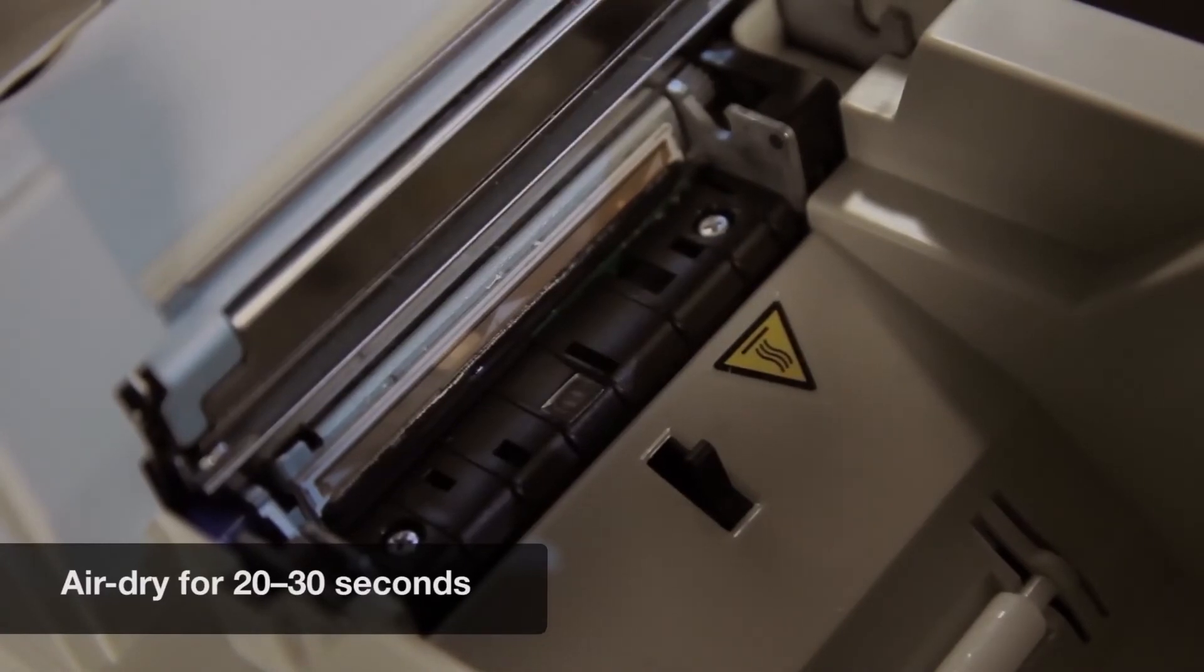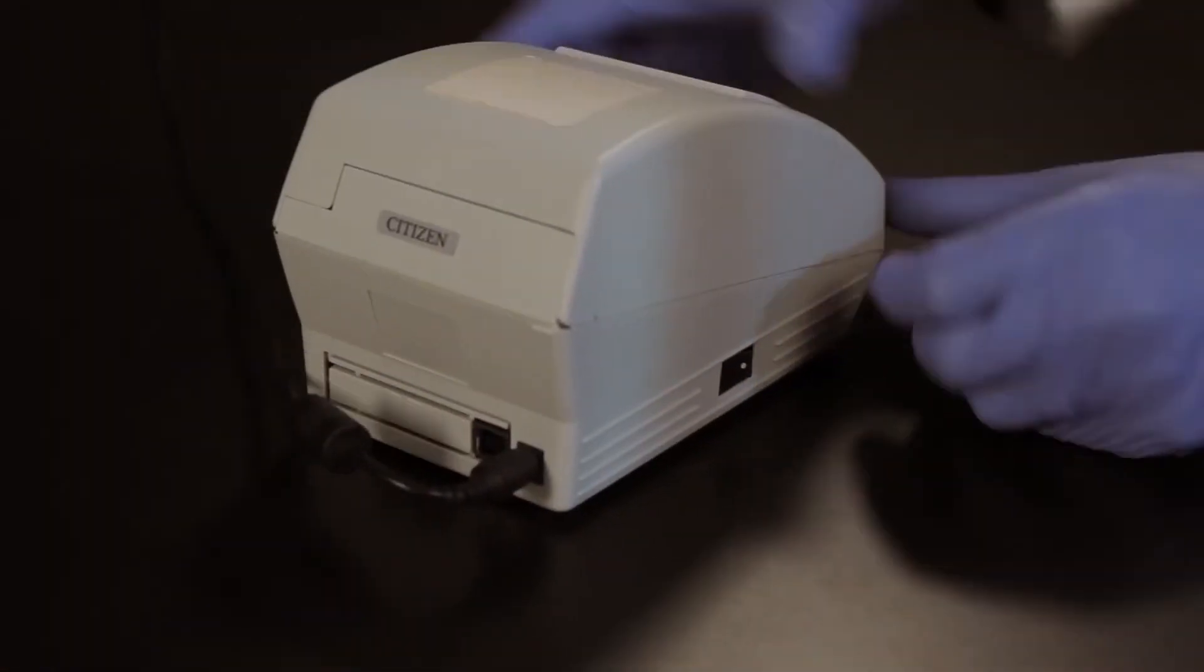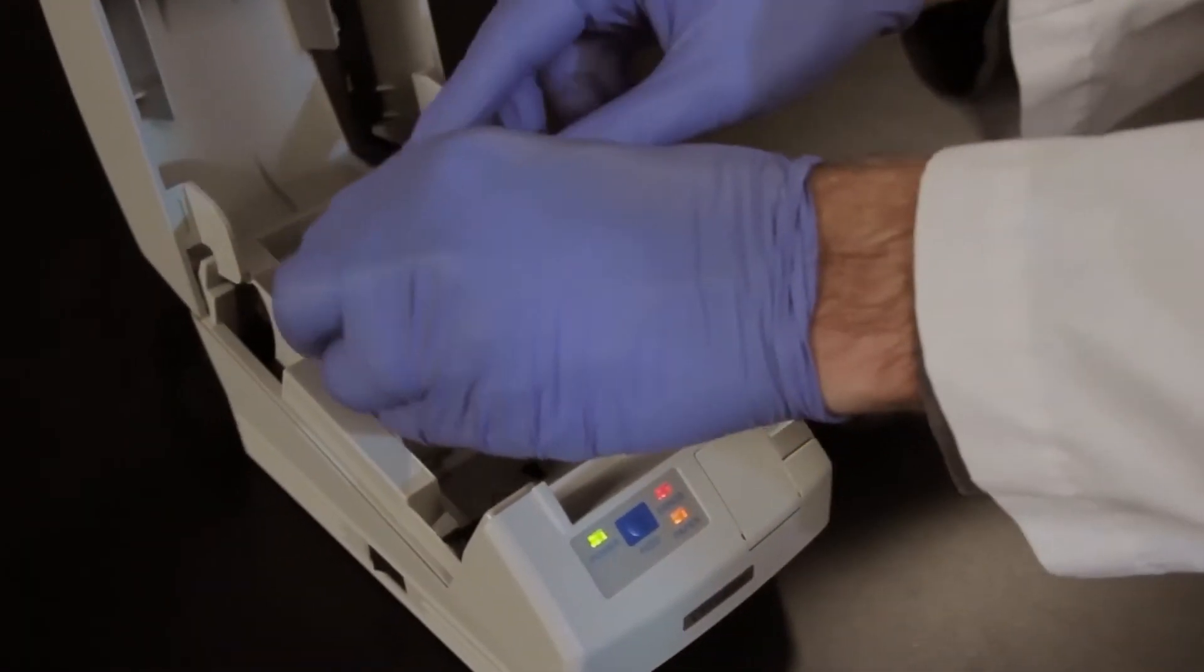Let the printer head air dry for 20 or 30 seconds, and that's it. Turn the printer back on and insert the paper roll.